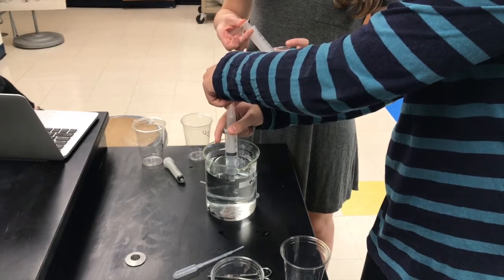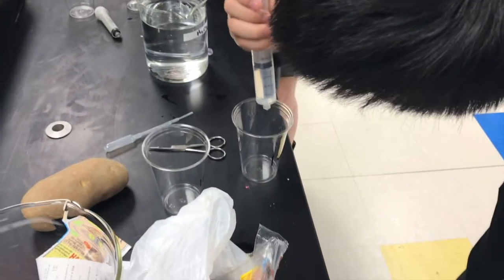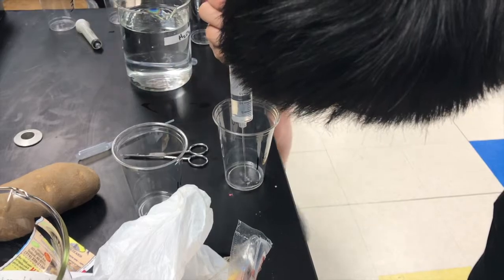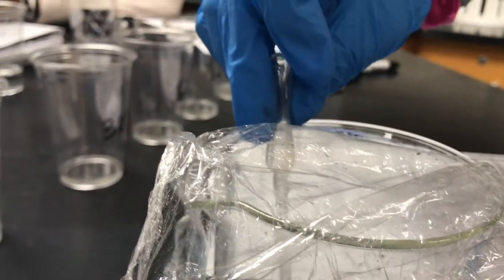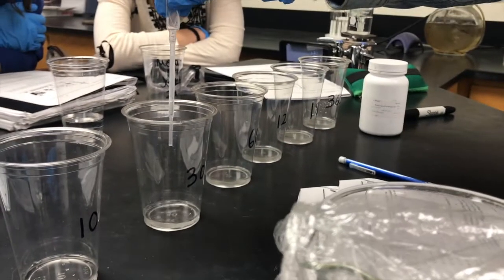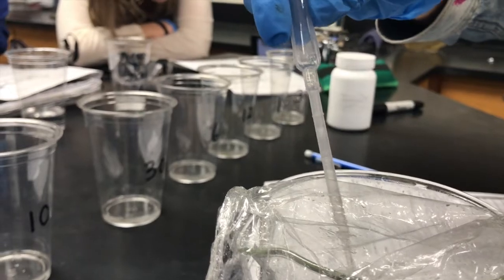The final part of our lab had the purpose of determining the rate at which a 1.5% hydrogen peroxide solution decomposes when catalyzed by the purified catalase extract. The experiment is fashioned to test H2O2 levels after the following intervals of time: 10, 30, 60, 120, 180, and 360 seconds respectively for chemical reactions to work in each cup. In this way, we were able to test the effect that time had on enzymatic reactions and subsequent substrate levels.